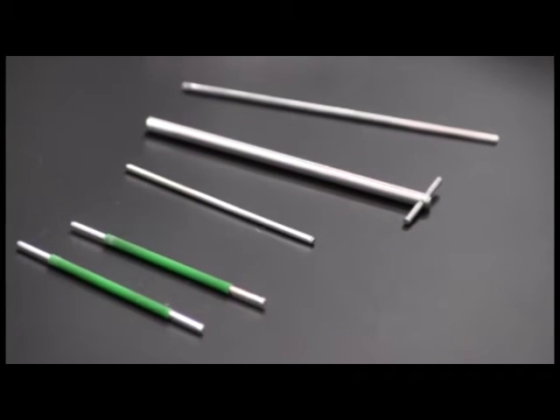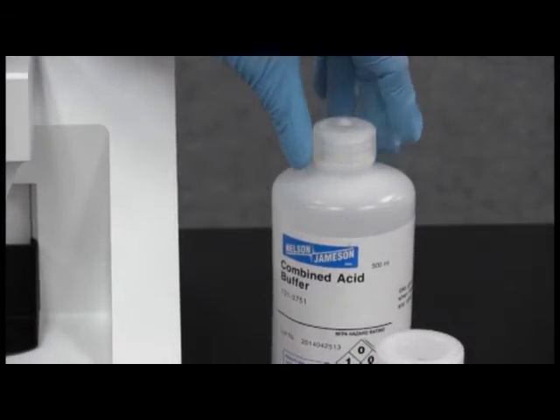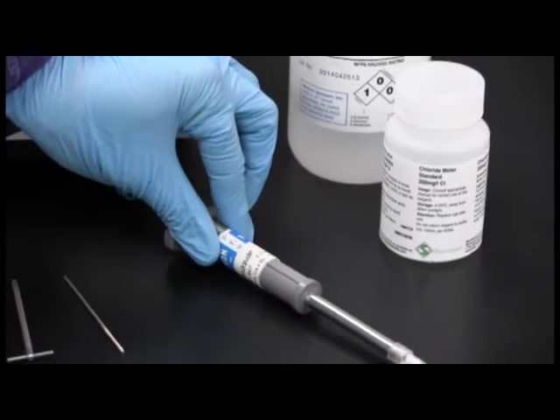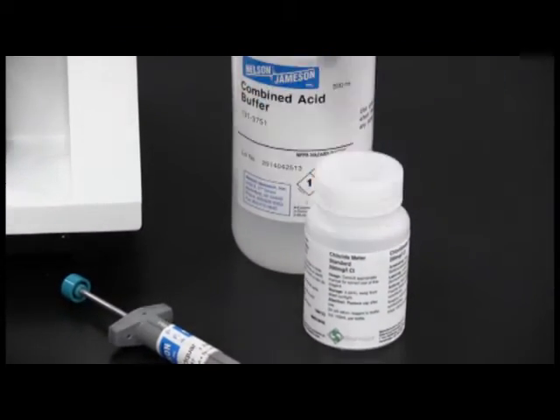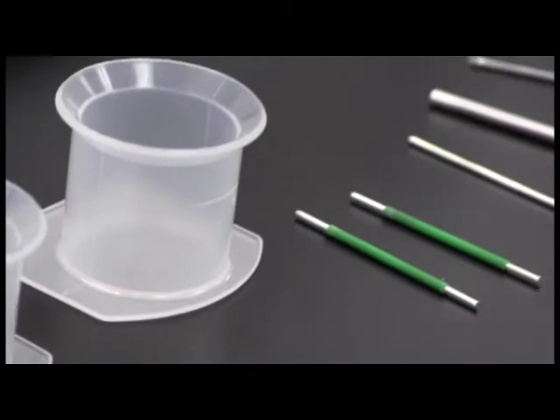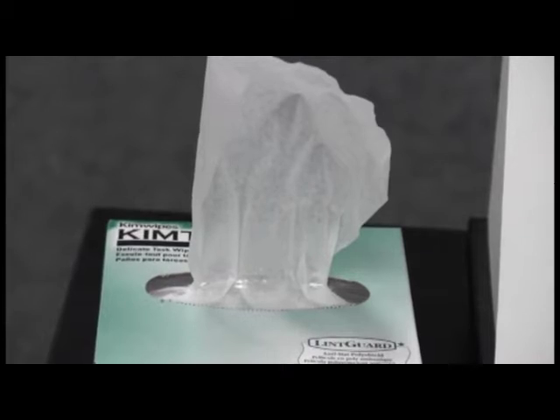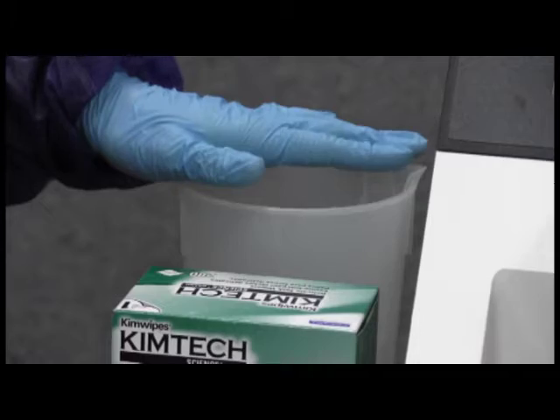The following are used with the Chloride Analyzer: Combined Acid Buffer, Calibrated Positive Displacement Pipette set at 500 microliters, 200 milligrams per liter Chloride Standard, Beakers, Silver Electrodes, Stir Bar, Clean Tissue, Distilled Water, and Waste Beaker.